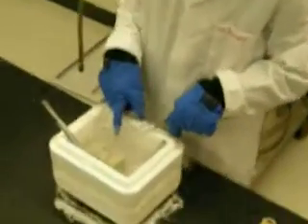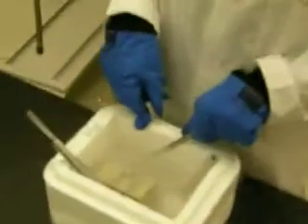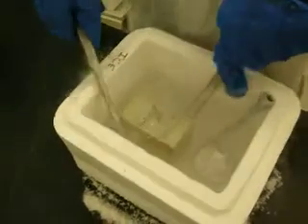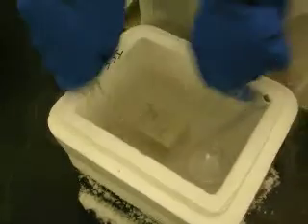That's right. See, they actually fractured that time. Did they? Right there. Oh, look at that. Beautiful. Oh, shit. Oh, fractured. But then you can snap that one, right? Yep. So would you like a picture of the lovely snapping technique we've developed? Let's do that.